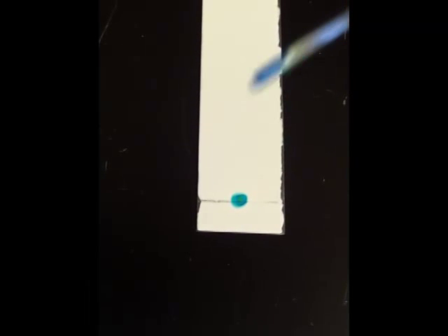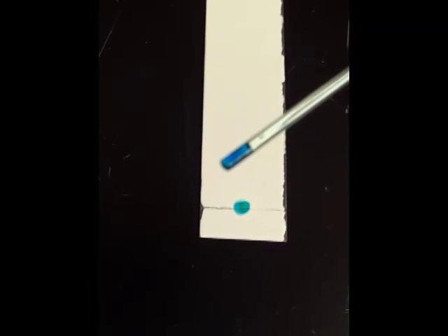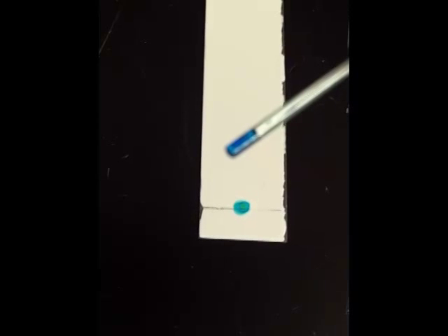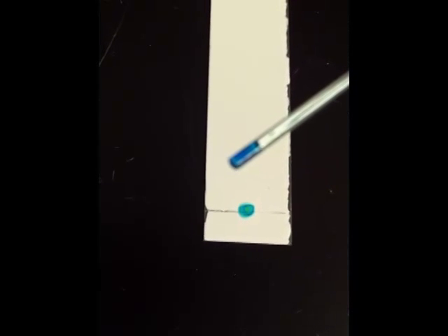And if you need to get some more of the pigment then just repeat the process of putting the capillary tube in with your finger off and then drawing it up, and then keep your finger on it throughout the entire test.